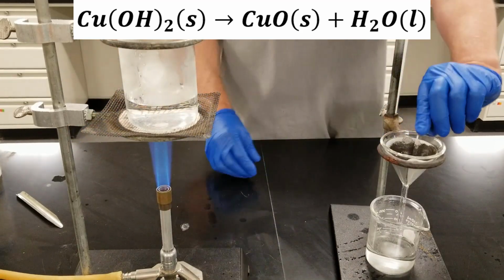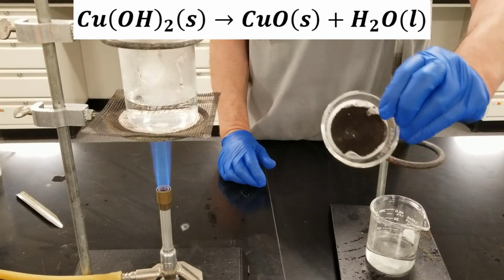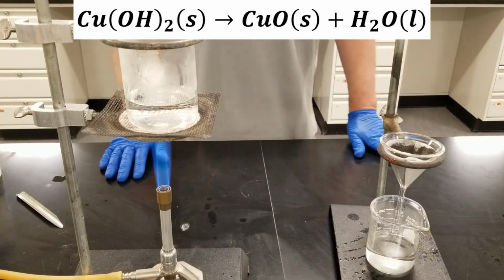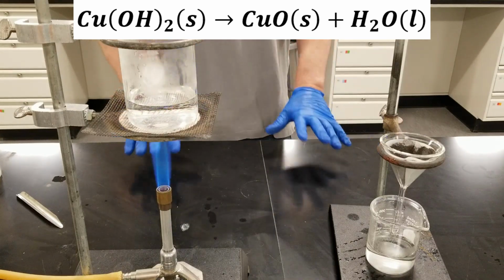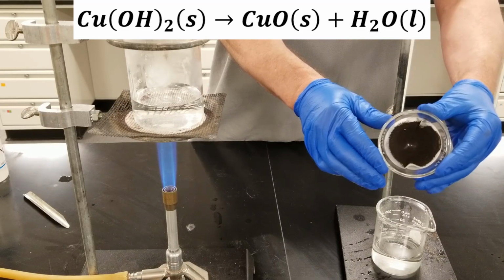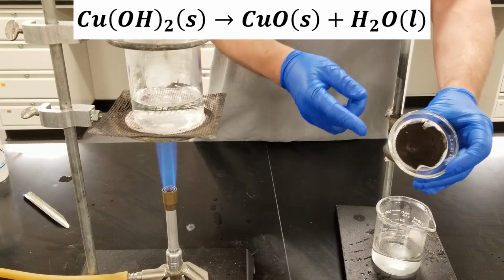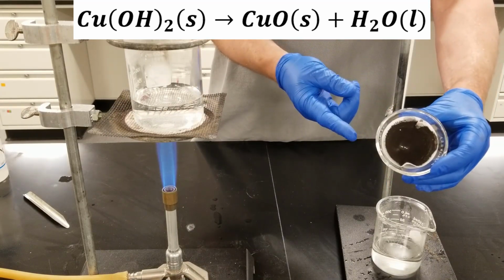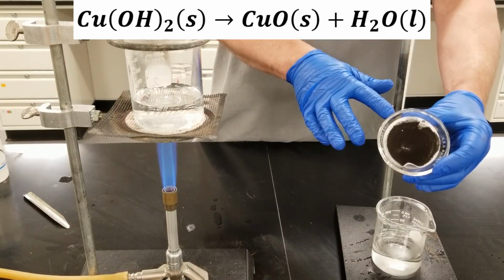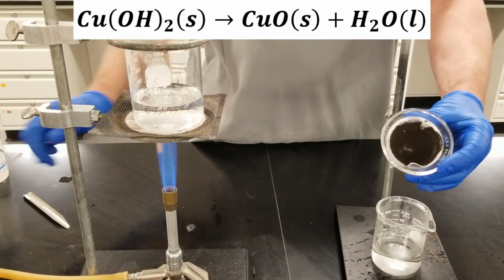Okay, so here's our black muck of copper oxide. Now I want to rinse that off with some nice hot water. The reason we do this is it's not pure copper oxide. It's got some nitrate ions from the earlier steps. If I don't get rid of those nitrate ions, I'll have some problems in step 5.